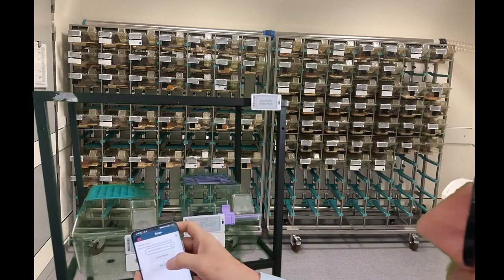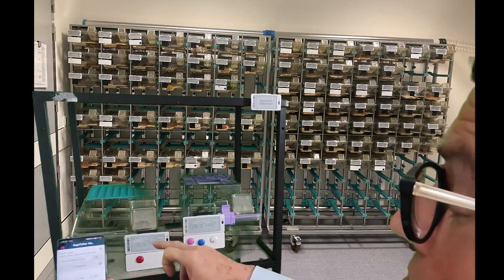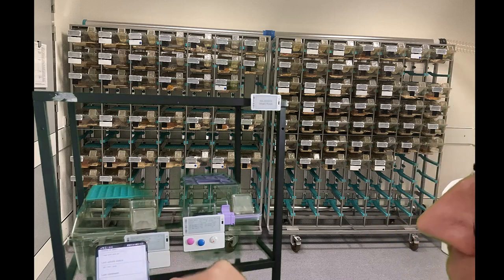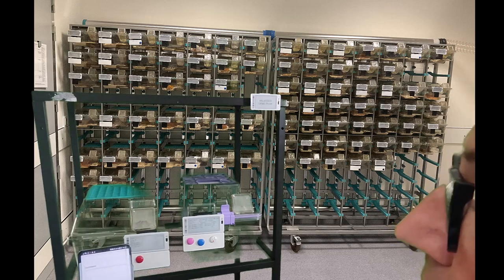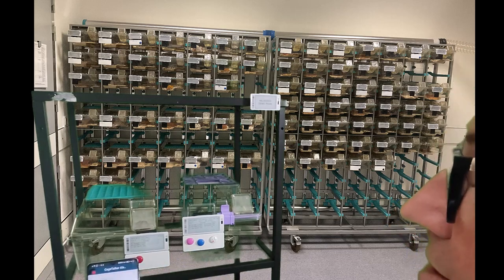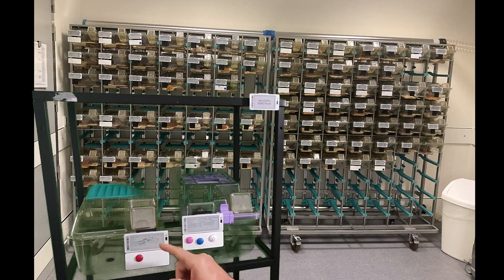Now I'm getting this cage, and after a while the app will show me the corresponding cage talker, and I have a selection of alerts which I can set, and I choose the one with the red button. I could enter a comment to explain a bit more in detail, but I will only update. And after a while, you see it's updating, and you see the message here, found. We also see that the messages have been sent with our normal email, and then the cage talker itself will show a watermark which also describes that there is a sick animal in this cage. You see, found contains a sick animal.